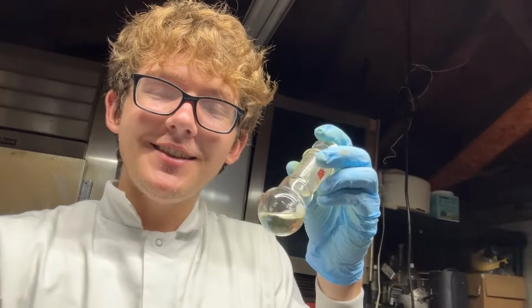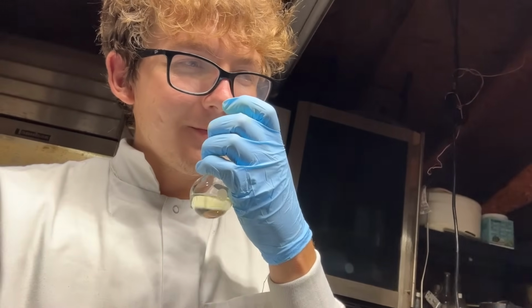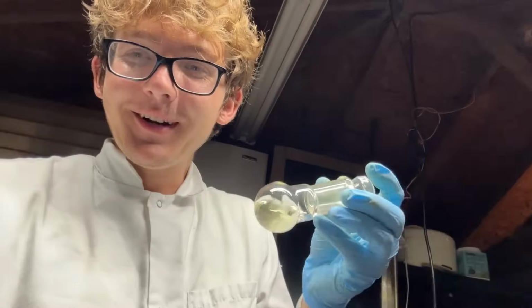Yep, that smells like fermenting socks, like foot odor. This is like the sour smell of foot odor. If you really let some socks soak in some sweat, this is the kind of smell you'll get. It's kind of sour, like acetic acid, but there's other notes in there that I don't even know. It smells almost kind of fruity sometimes too. It's like a fruity sour type. It's not particularly a bad smell, not revolting, but it just smells like stinky socks. That's what it smells like.